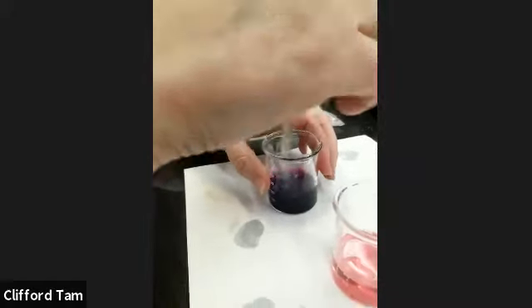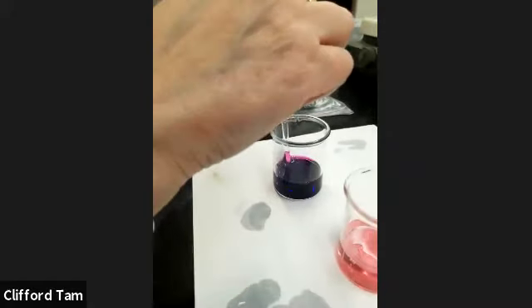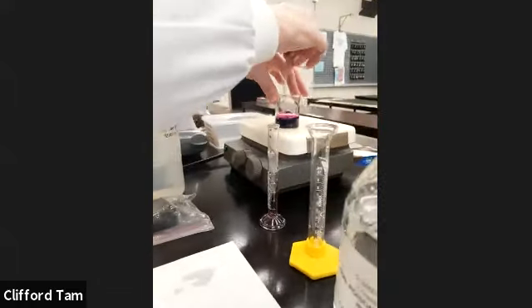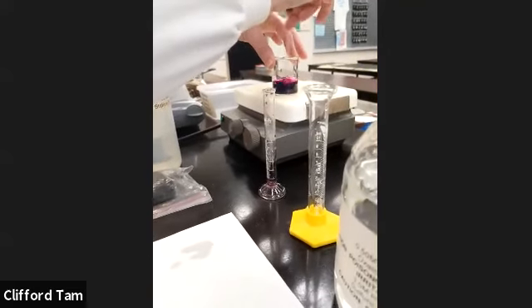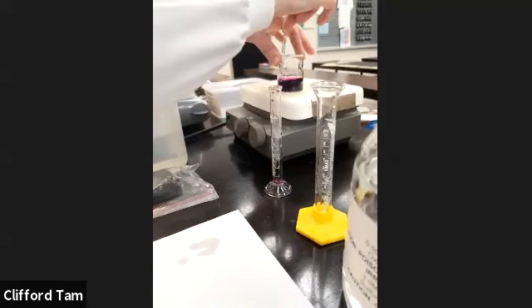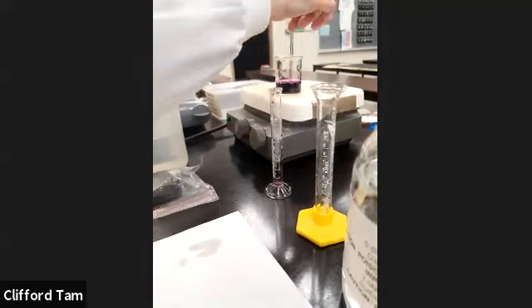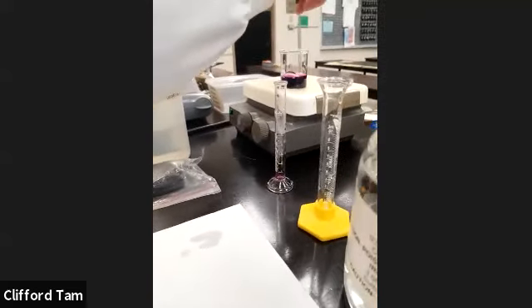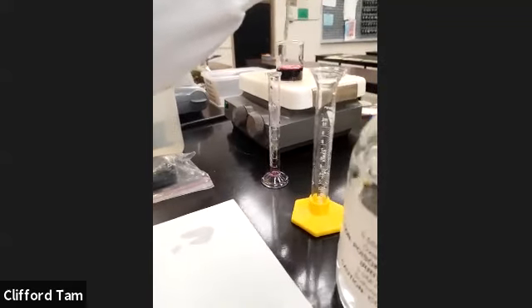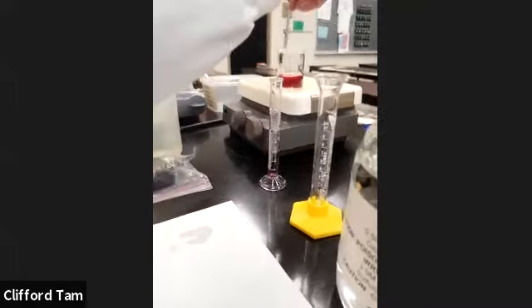Now remember, the one on the left is essentially warmer, or has more energy than the one on the right. So basically I'm going to heat the whole thing up and see if it takes longer, or less time. So if it took less time to get to this nice red color that you saw earlier, then we know that increasing temperature does indeed have an effect.